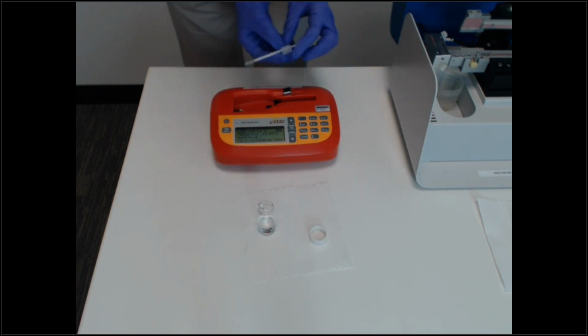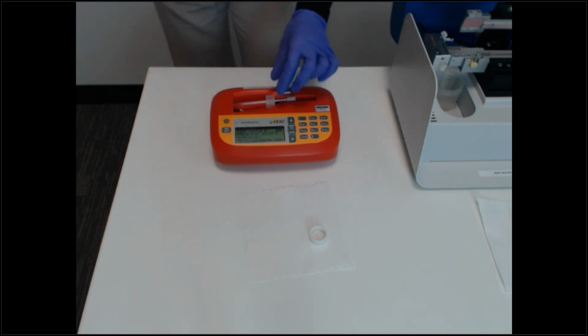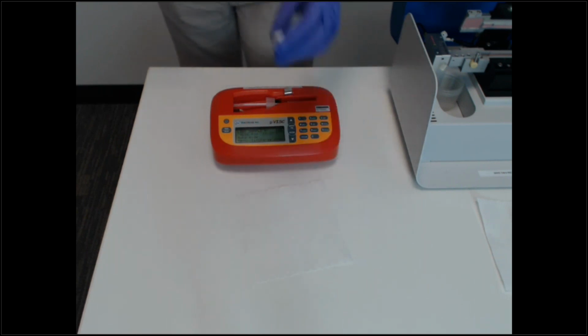And so then we will load up the Microvis by clicking in the pipette. And then at this point, we'll just hit run. And so I'm running in auto mode, which is where it picks the best shear rate for you based on the viscosity and the chip you have chosen. As you can see, the Microvis is very easy to use. It's as simple as loading a pipette and clicking run.